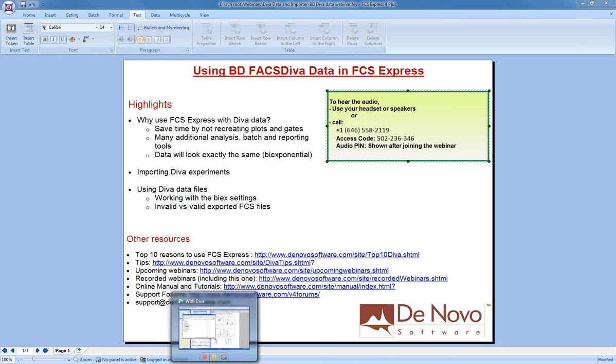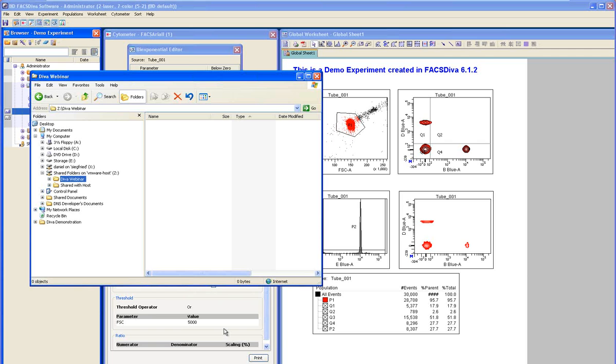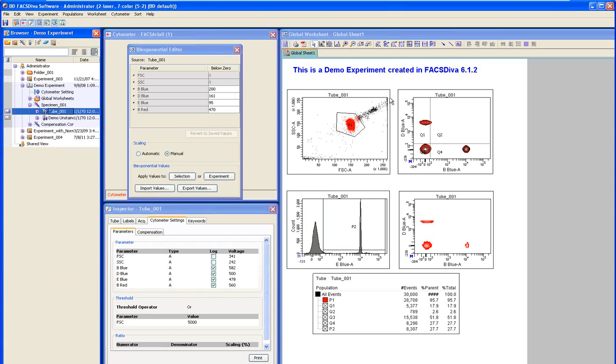So when I open up my window with Diva, what you see is Diva version 6. This also works in previous versions of Diva and in version 7. There are a few differences that you'll encounter when using Diva 7, and I'm going to talk about that a little bit as we go.